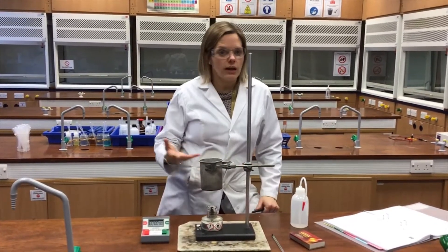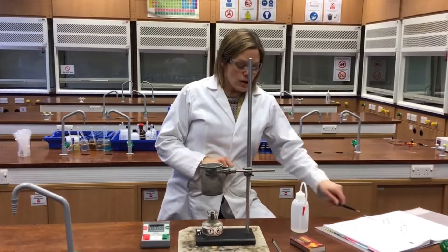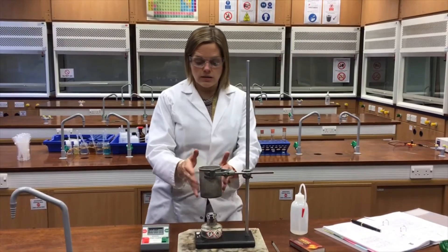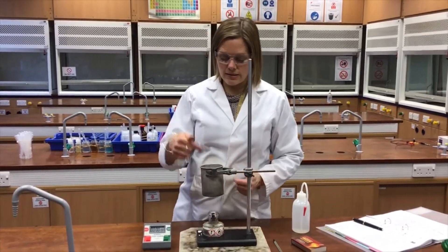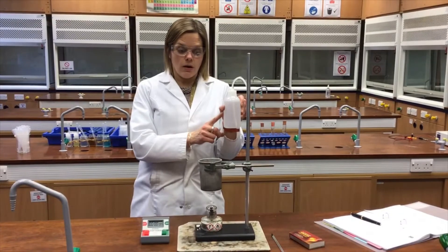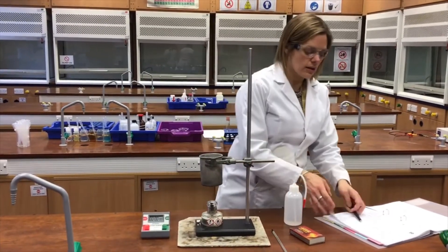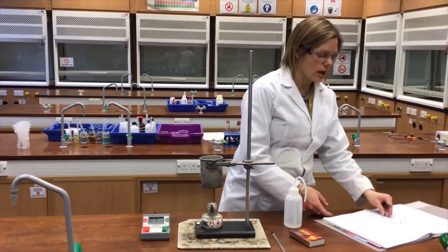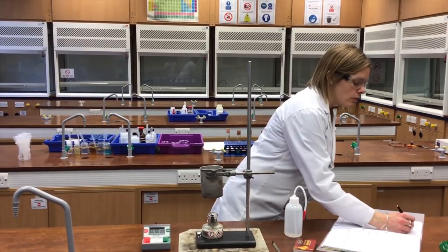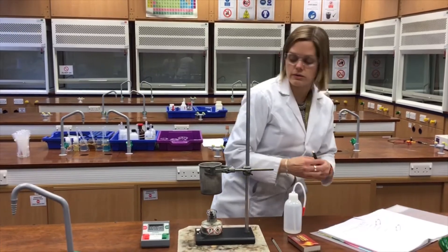There are different ways to get the same data if you wish. Inside the can calorimeter here — this is just a metal can — I've added 200 centimetres cubed of distilled water, already measured using a measuring cylinder.